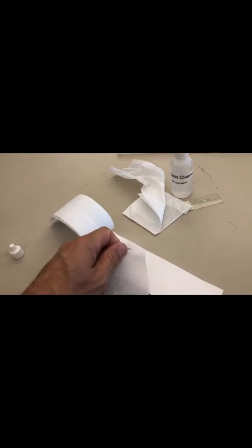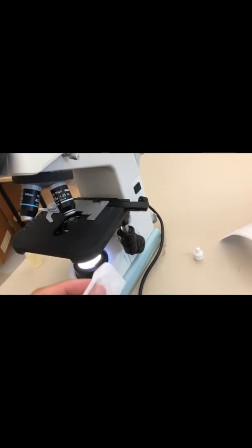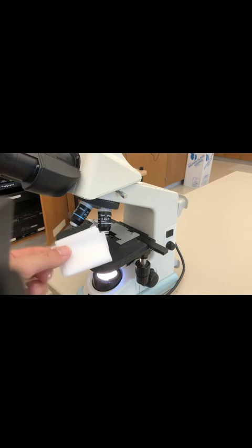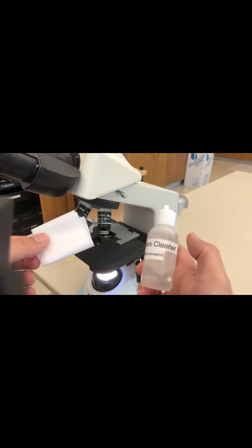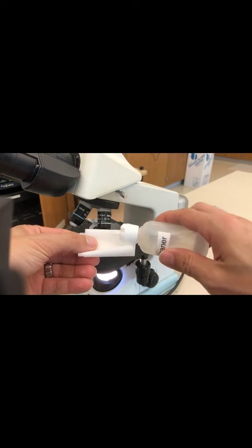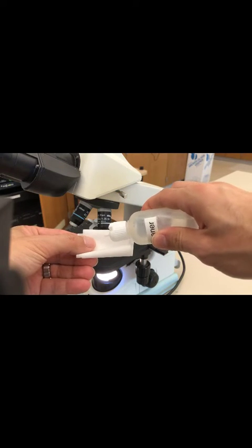Go ahead and tear out a sheet or two of this optical lens wipe. Fold it up. Get a little bit of your lens cleaning solution. Put a couple drops on there.